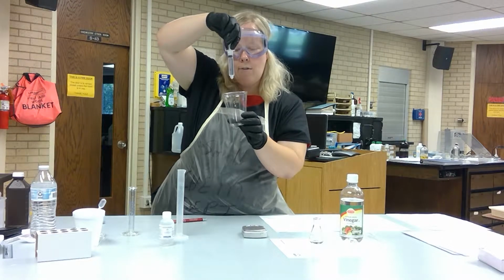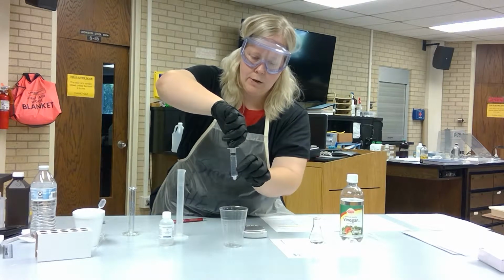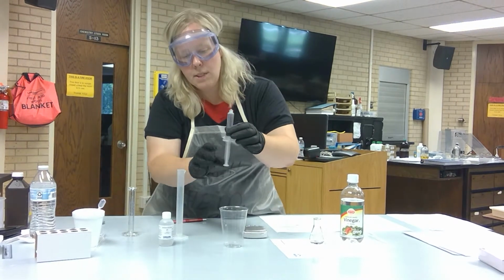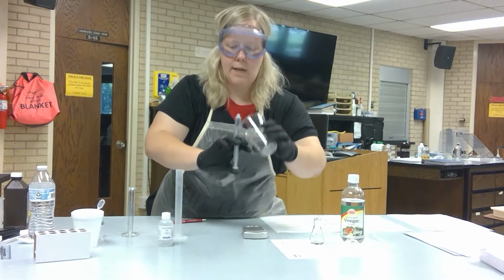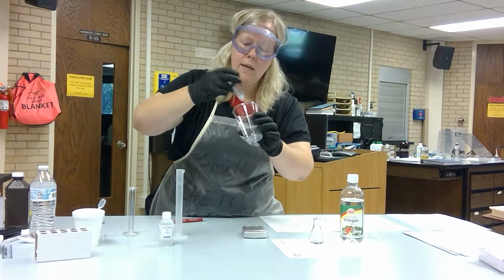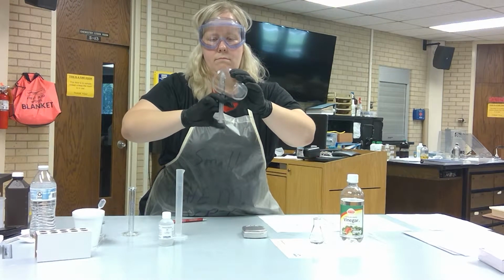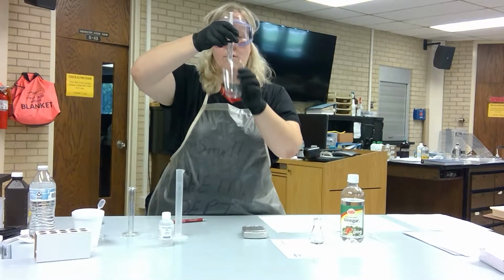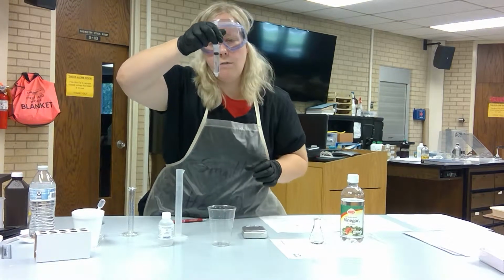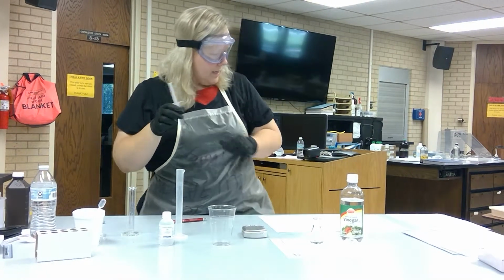I'll just do it now. You can see that I do have an air bubble since I've gone ahead and pulled this up. Just for demonstration, as I'm pulling up, it's not in any liquid, so I'm just pulling air. You can also, and this is a good way to dislodge any remaining air, tip it upside down. And just go ahead and have your cup next to you just in case. There we go, a little air bubble there. Give it just a little squirt. If you look carefully, you can minimize all of your potential air bubbles, so there should be no air present.